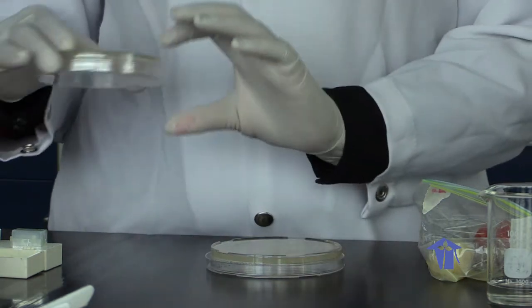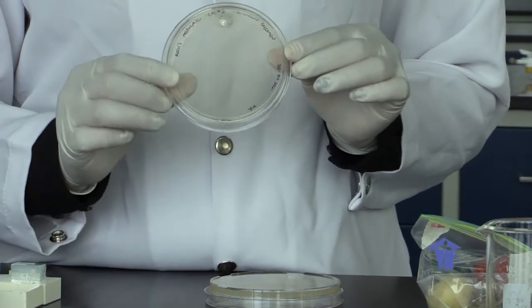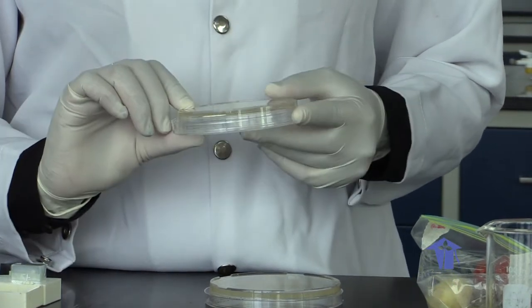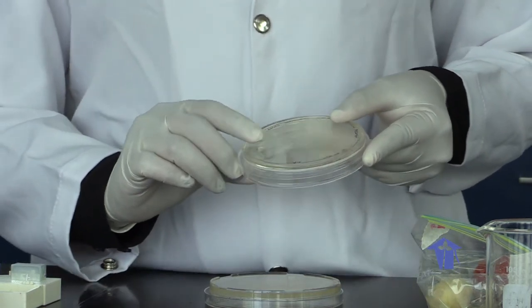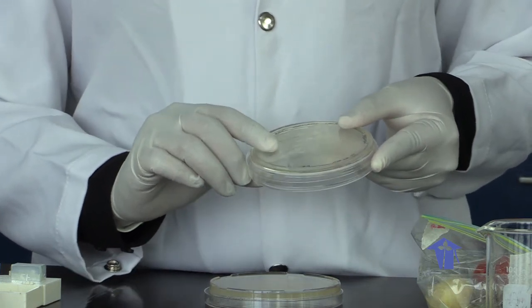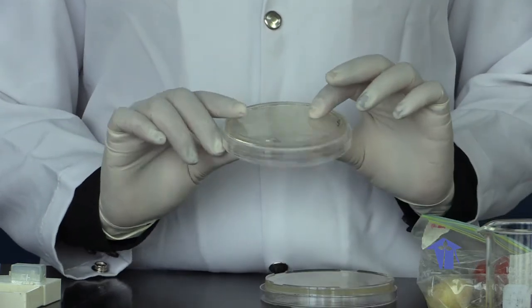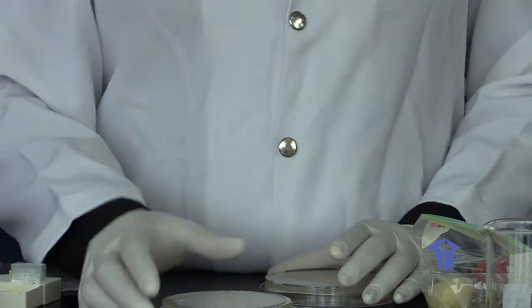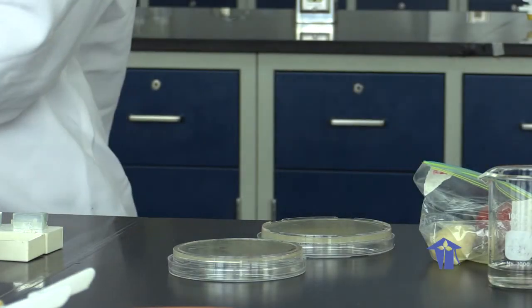Now this lab was done before, so we see here that we do have a sample that was inoculated for 24 to 48 hours. We do see that we would have growth taking place. When we looked at the characteristics of the colony, or the colony morphology, it was observed to be similar to that of our initial organism. A gram stain was done on this specimen. It was viewed under the microscope at 40 times magnification, and that image will be provided to you so that you can see whether or not the characteristics of that organism were the same as our first organism that was isolated. So that's it for your Koch's postulates lab.